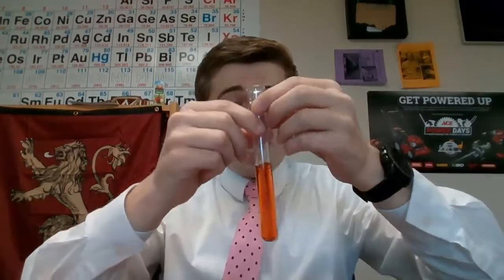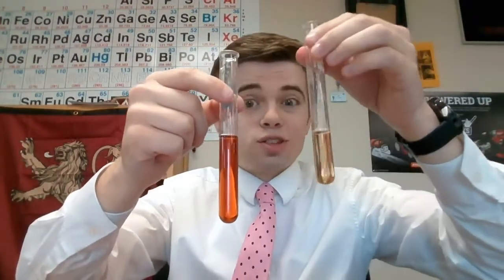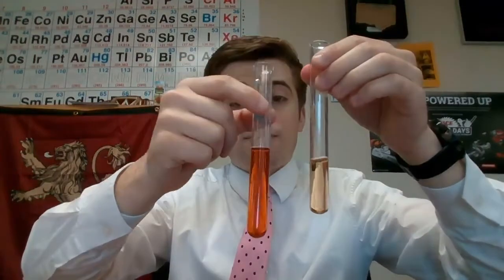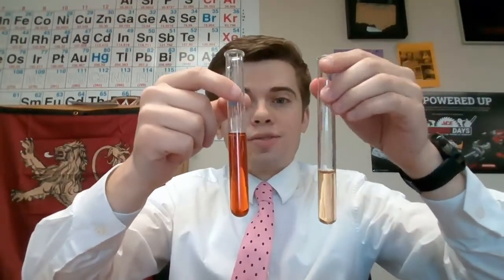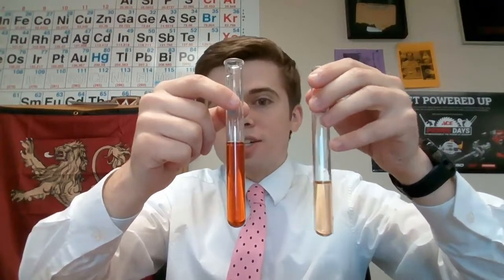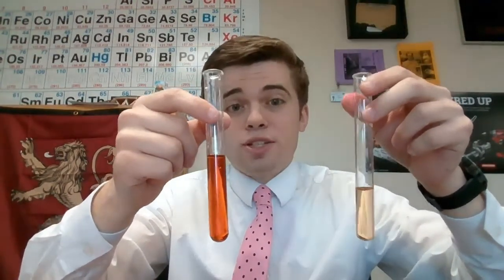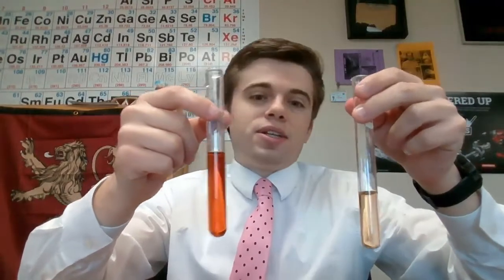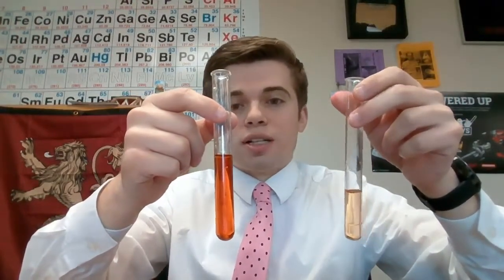I want you to write down what happened in this reaction. What physically changed here. And this is our control solution. So what happened to this solution whenever we added the iron 3 chloride? Go ahead and record that in your notes and see if you can tell me what direction equilibrium shifted. You'll need to look at your chemical equation for this, which was given right above the video, actually, in your little stimulus portion of the Canvas assignment.